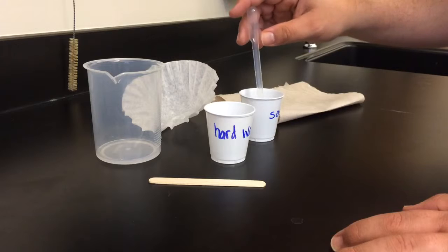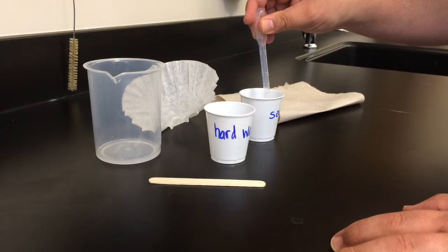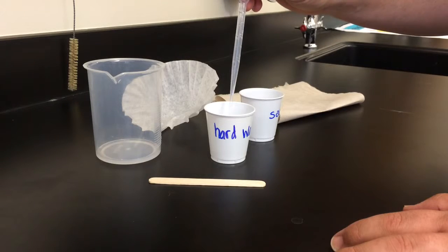So if you go straight to the bottom and then squeeze your bulb to push out any air, that gets rid of any pieces that might be attached to it and then draw it up slowly and take a look and try to avoid pieces of soap.